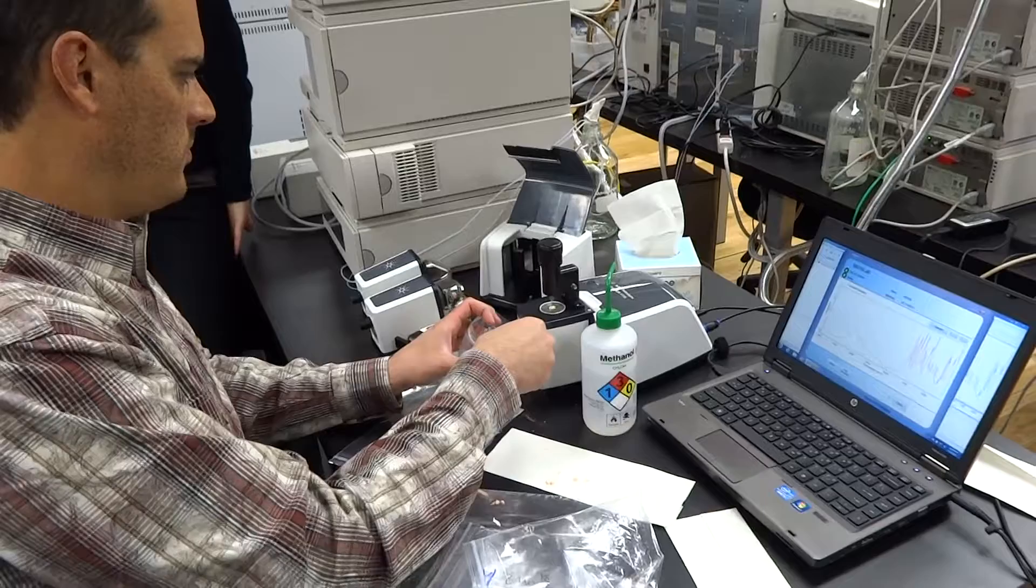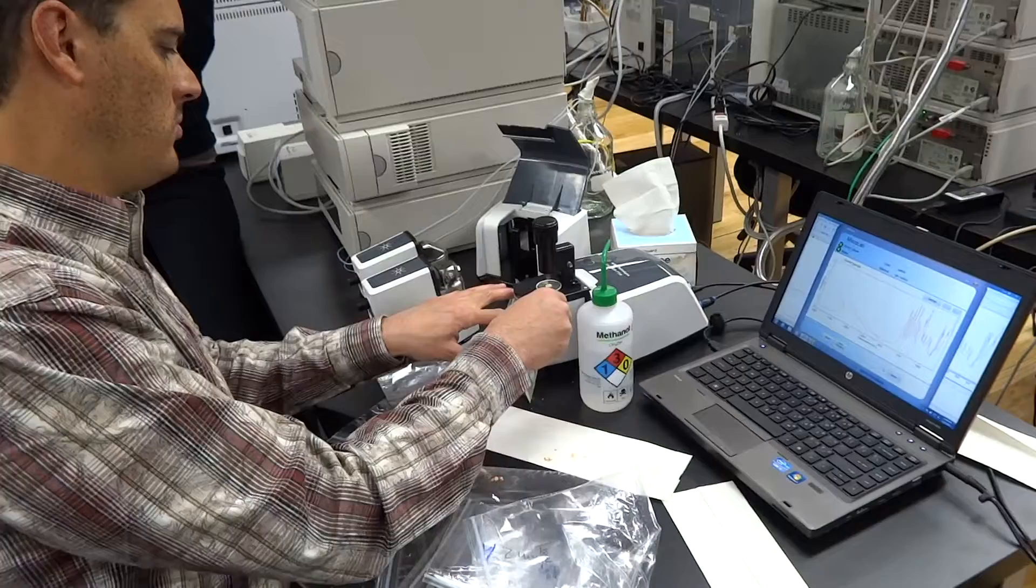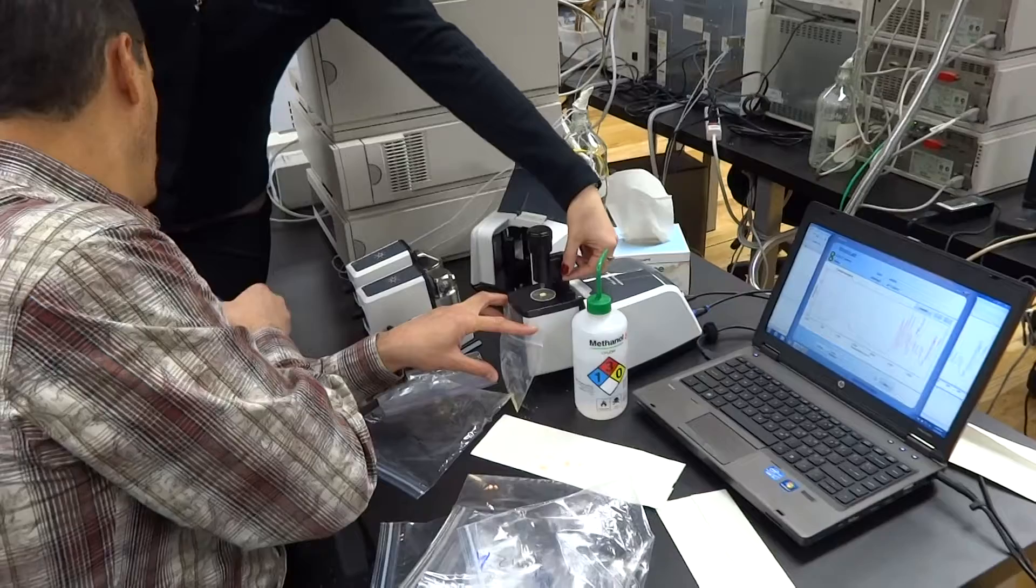So it just does a quick... And then when you say acquire, then it goes through and it actually does... The first gives you live spectrum. So sometimes there's not enough contact. It's a solid sample. You might need to correct... And we have different tips. There's another tip here.